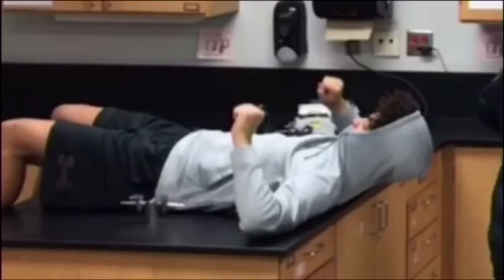You can easily fall off the counter of the lab table. Absolutely no fighting or horseplay in the lab. It can cause destruction of whatever you're working on, and it's just unsafe.